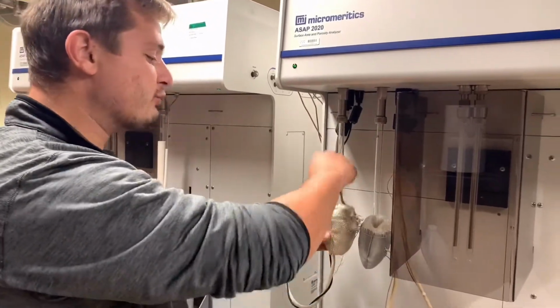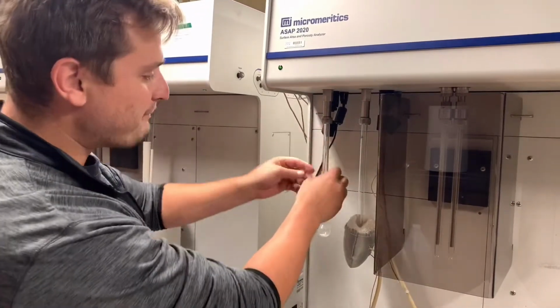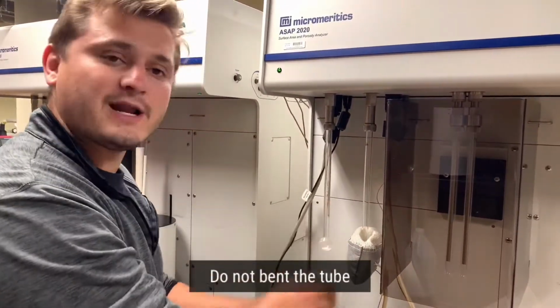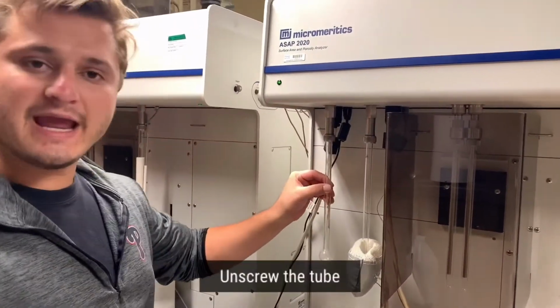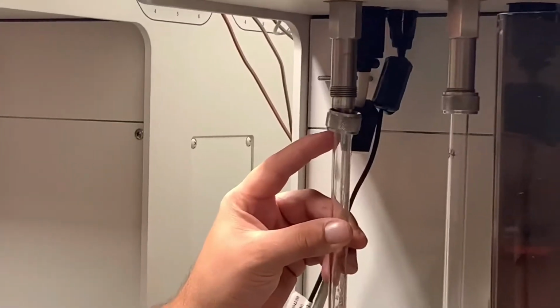So first, we will remove the metal clamp holder and then carefully remove the heating mantle, making sure we do not bend the sample tube back and forth, removing the heating mantle straight up and down. Next, while maintaining a firm grasp on the sample tube, we want to unscrew the sample holder from the instrument.